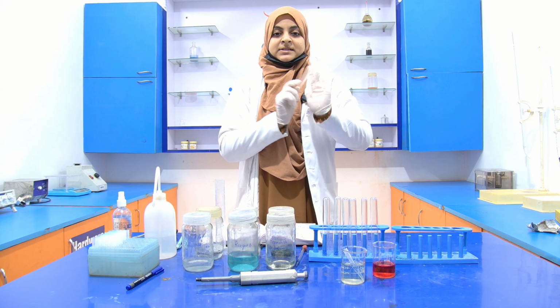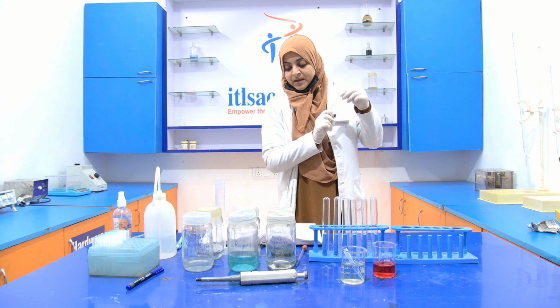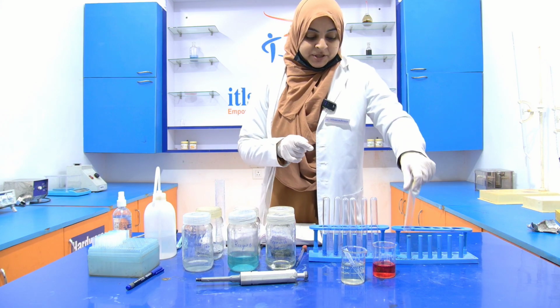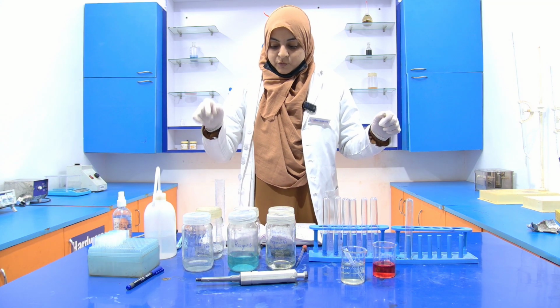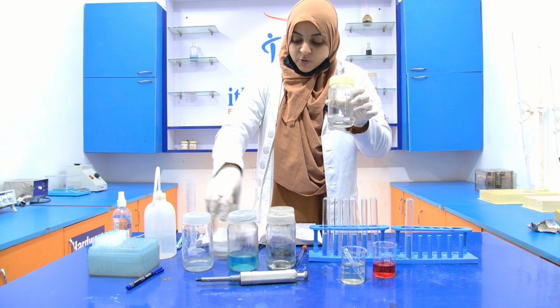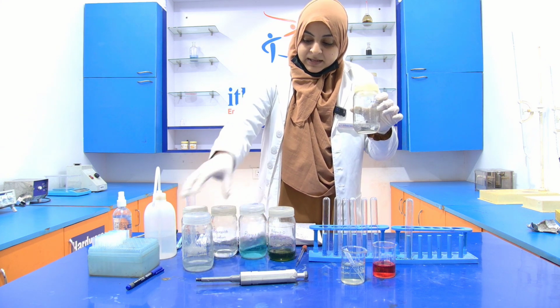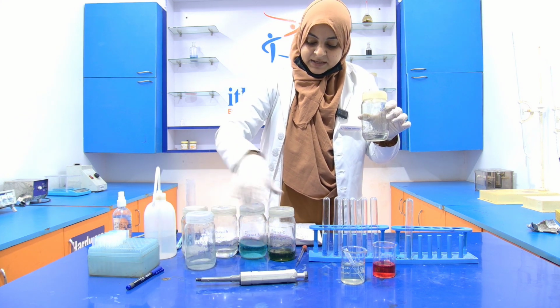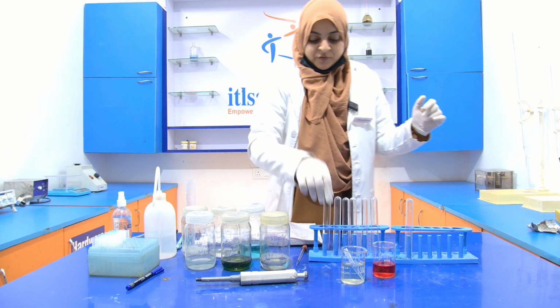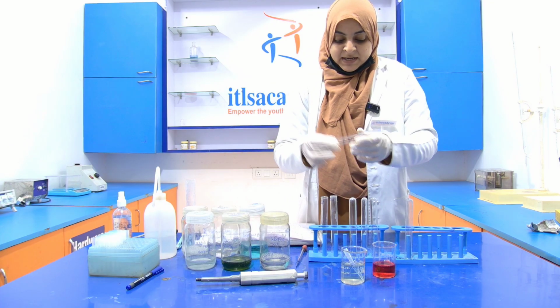This means that in this test tube, I am not going to add any BSA, just the distilled water and the reagent. Now, first of all, what we have to do is take the working BSA. We require only three types of reagent: reagent C, reagent D, and the working BSA. So first of all, add different concentrations of the BSA into the test tubes.